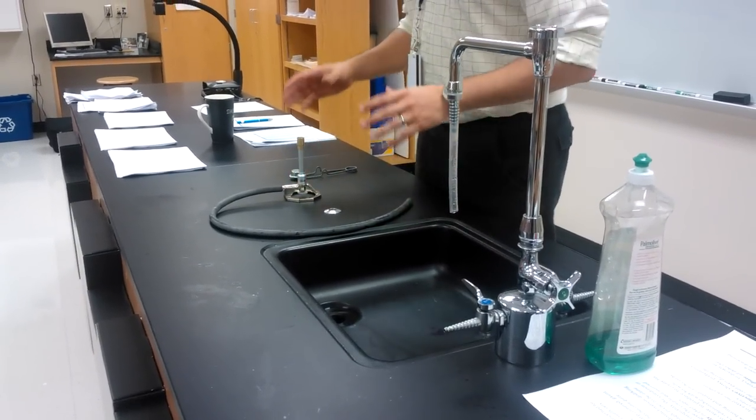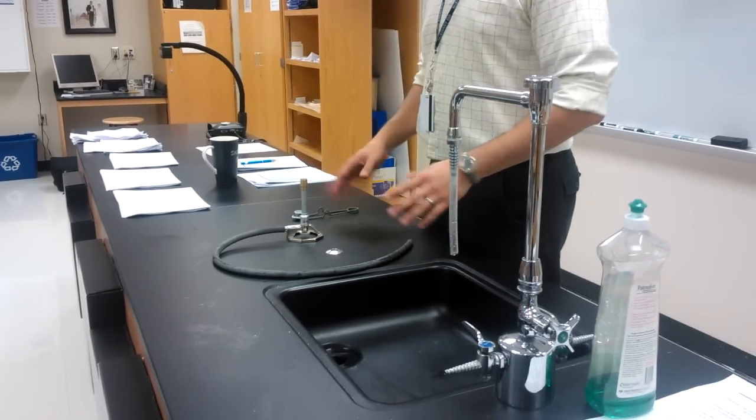Alright, so we're going to learn real quick the proper way to inspect the Bunsen burner and the proper way to light it.